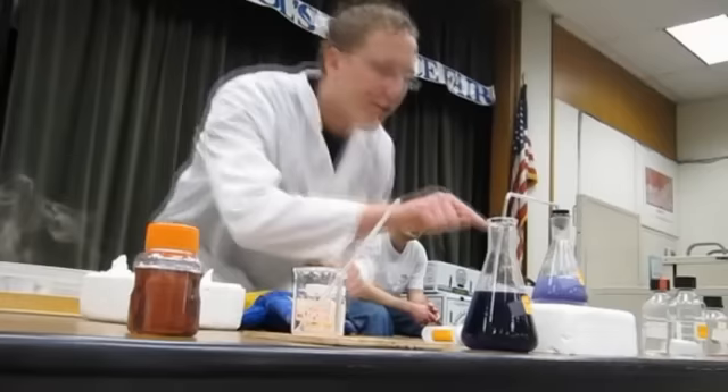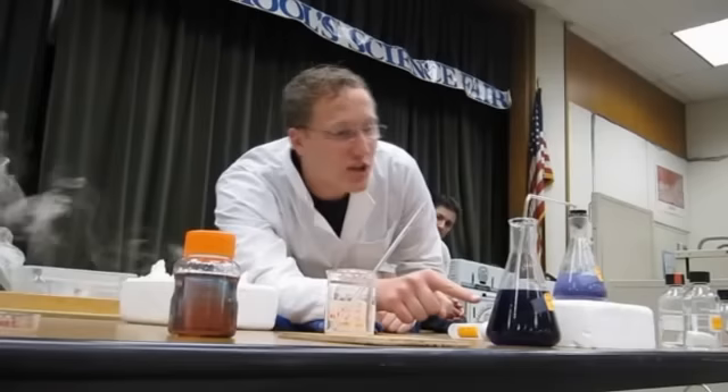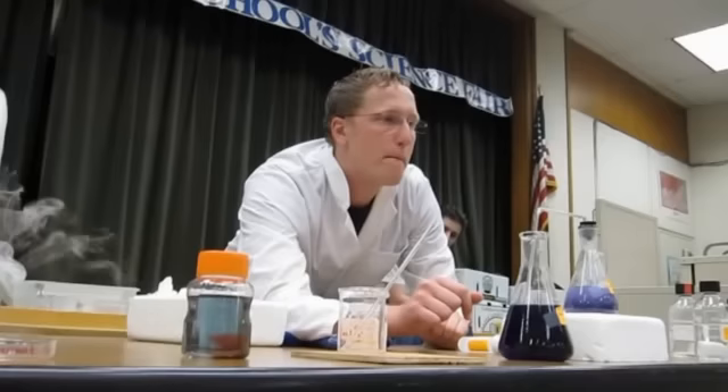It formed ammonia. Can anyone tell me where you can find ammonia? Ammonia gas — that's what bubbled over there. You can find it in Windex. Has anyone smelled Windex? Yes, that's the smell of ammonia. If I open this up I will smell that ammonia. So we formed gaseous ammonia, it moved over here into this vessel, and it changed color to purple. This tells us ammonia is a base.